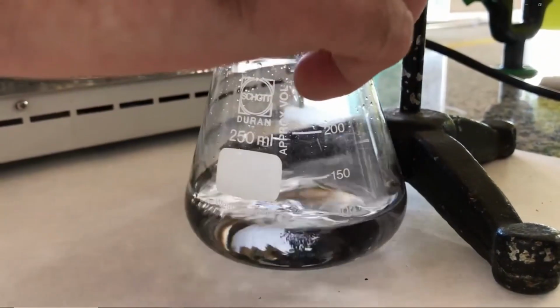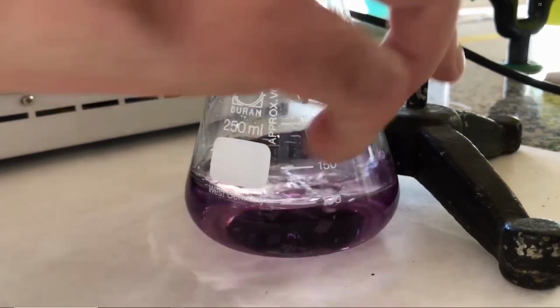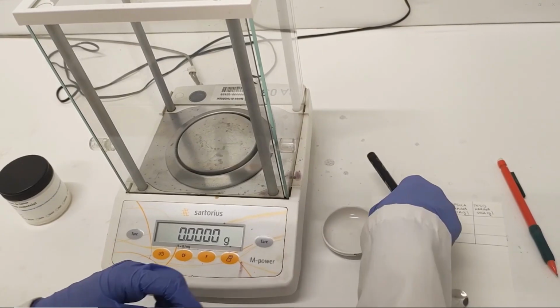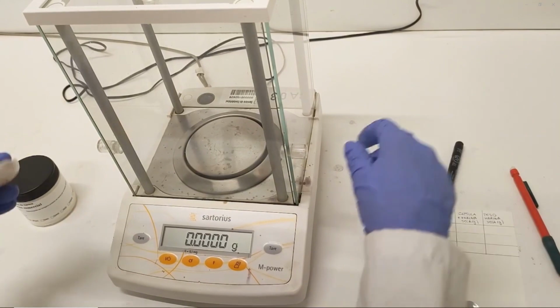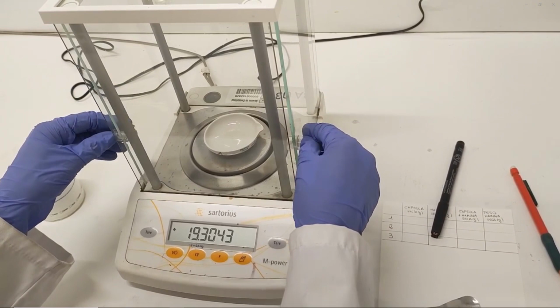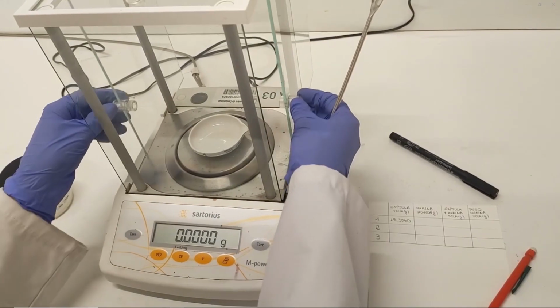By knowing both the exact concentration and the volume of the sulfuric acid that has been consumed in the titration reaction, the protein nitrogen content of the flour sample can be determined. Since the nitrogen content must be calculated using the dried sample mass, it is necessary to determine the humidity content of the flour sample. For this purpose, 3 completely dry and labeled porcelain capsules are weighed on an analytical balance, recording the exact weight of each of the capsules.